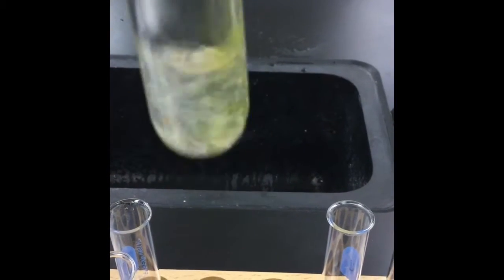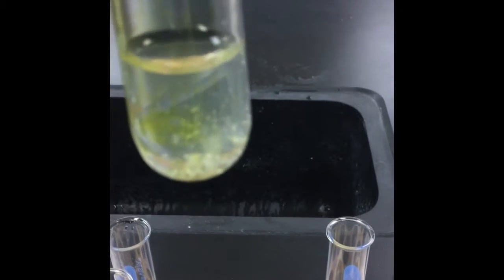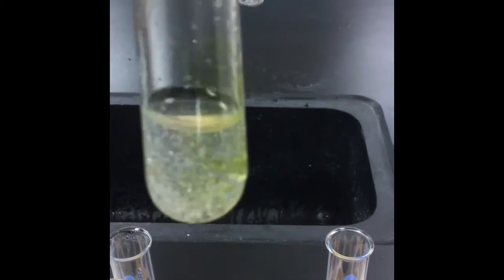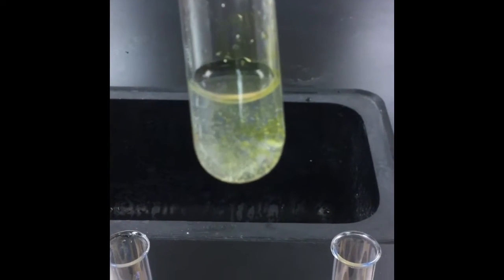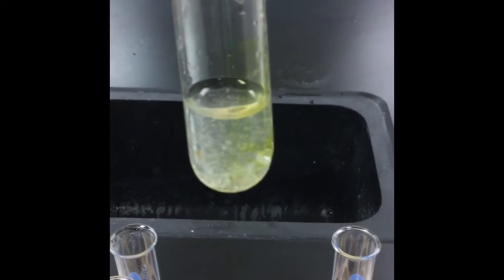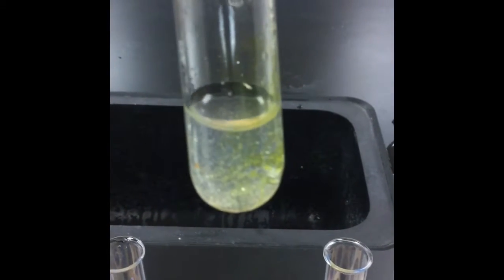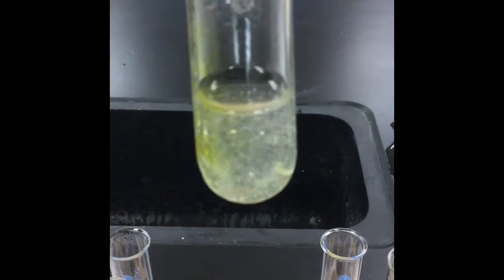Kind of hard to see for you guys, but I have a gray substance that formed. You can kind of see it swirling around. The copper wire is still in the bottom, but I have this shiny gray thing that's just formed on the surface of the copper wire. So it looks like we have another type of replacement reaction going on here. So write out all of your observations in the data table for procedure number 6, and write out a balanced chemical reaction for copper and silver nitrate.